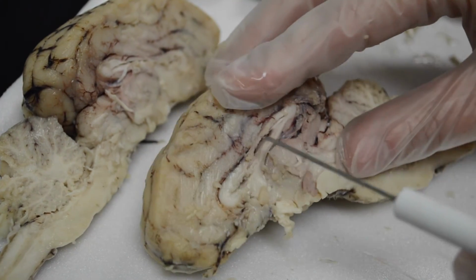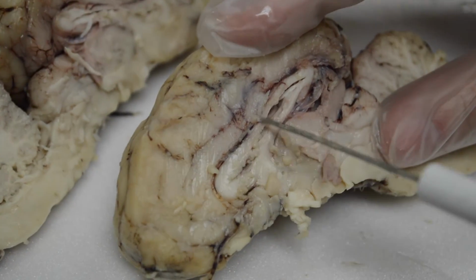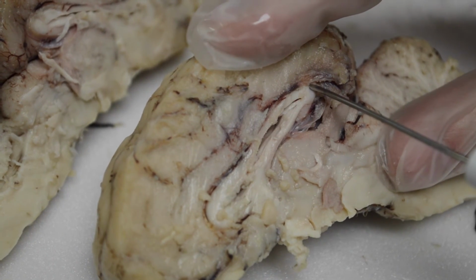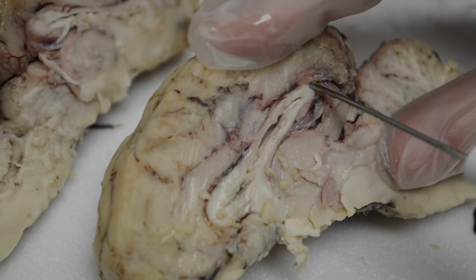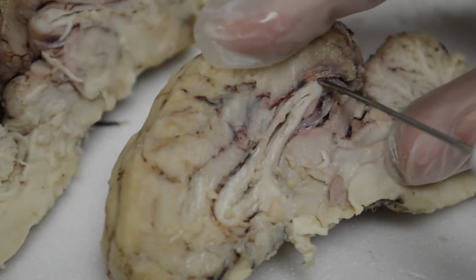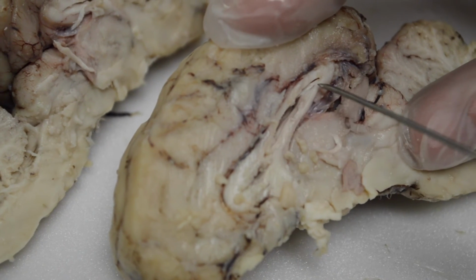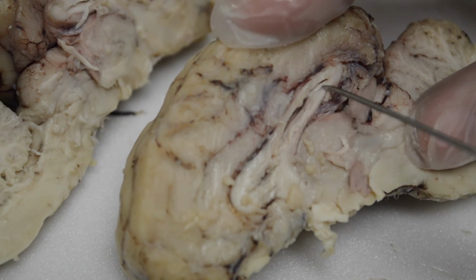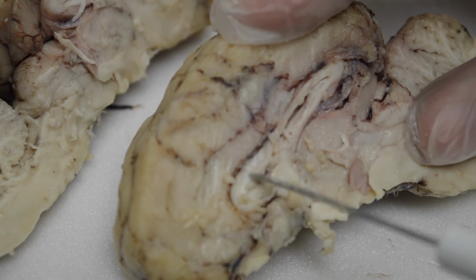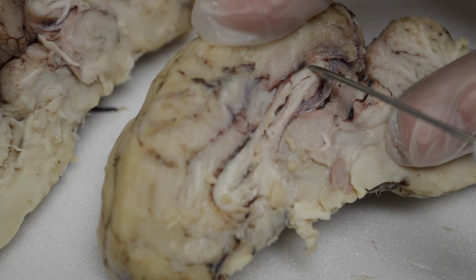Now, let's name these structures below and on top of the ventricles. So this one here that's like a hook, see that there? It starts down here and it comes around the top. Very big, very broad. It's called the corpus callosum, a very famous white matter tract that connects the two hemispheres of the cerebrum, the corpus callosum. Underneath is another structure called the fornix. So this under the lateral ventricle is the fornix. On top, making the little hook there and going around, is the corpus callosum.